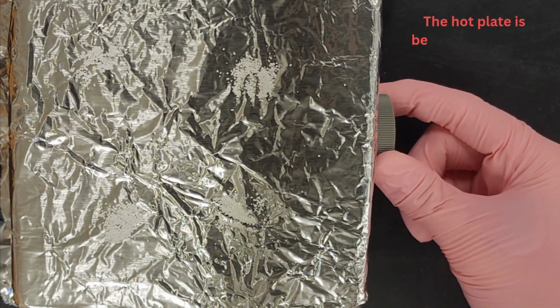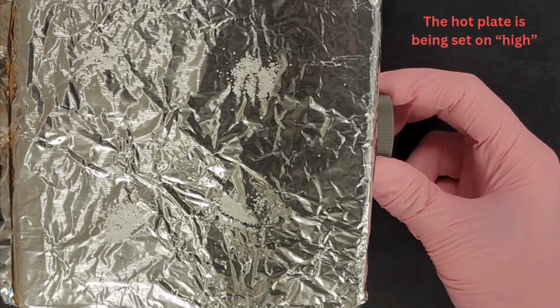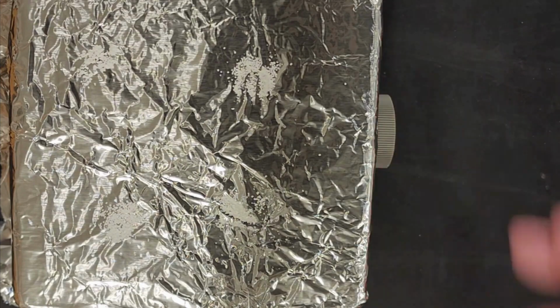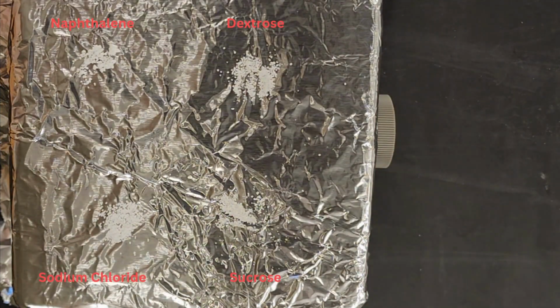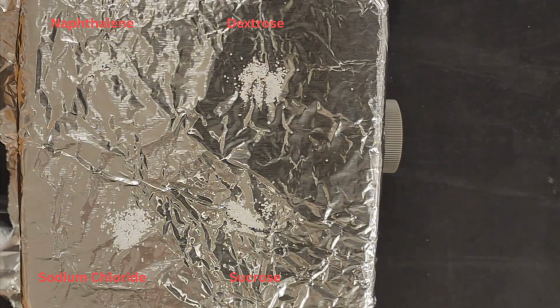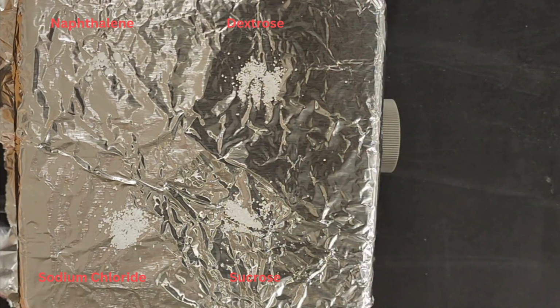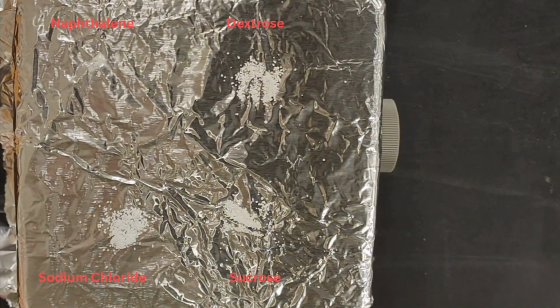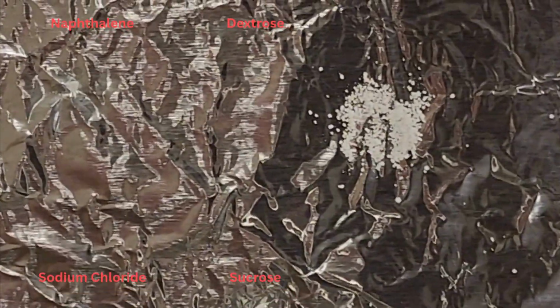For the actual part of this experiment, each chemical will respectively be placed in a corner of the hot plate, as the hot plate will then be turned on, and the chemicals will be observed as they are heated up. After about 3 minutes had passed since turning on the hot plate, you can see in the upper left-hand corner that the naphthalene began melting very quickly and then evaporated. It was the first out of the 4 chemicals to do so.